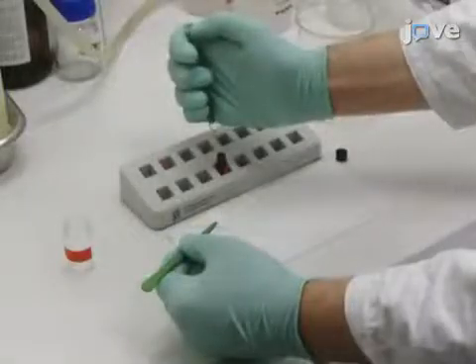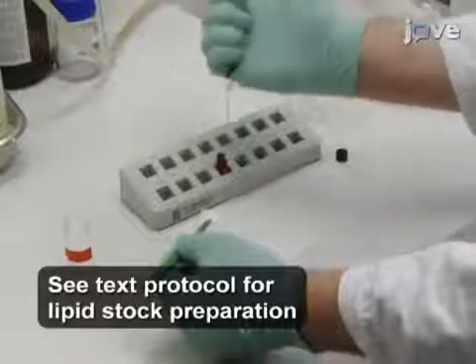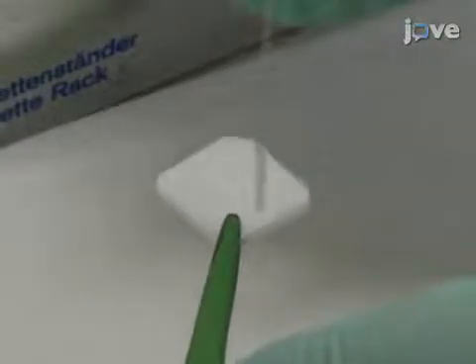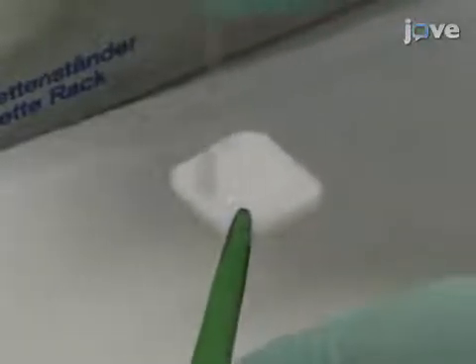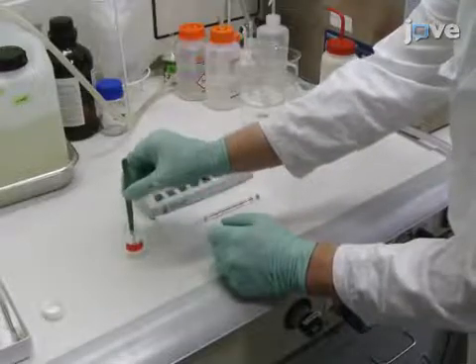Use a 25 microliter glass syringe to deposit 10 to 15 microliters of lipid stock in chloroform onto the rough side of the clean, dry PTFE plate. Spread the lipid stock with the syringe needle to create a uniform lipid film. Use tweezers to transfer the plate to the 15 milliliter vial.